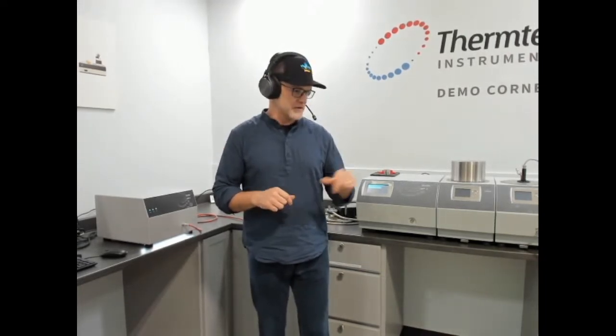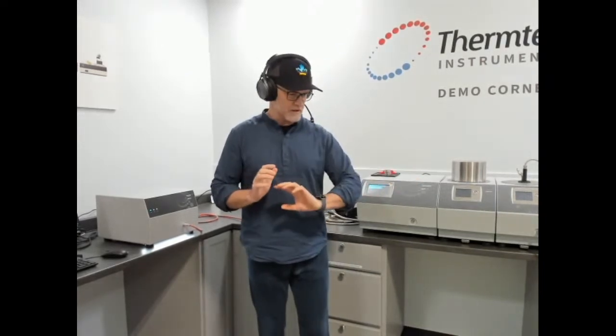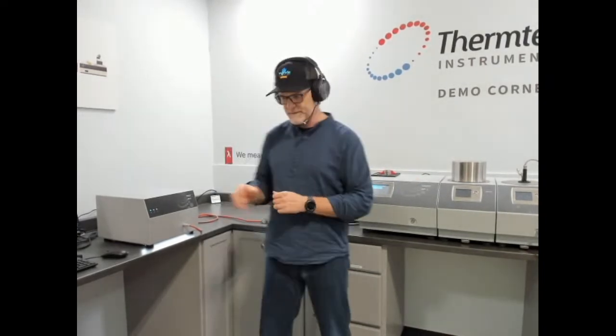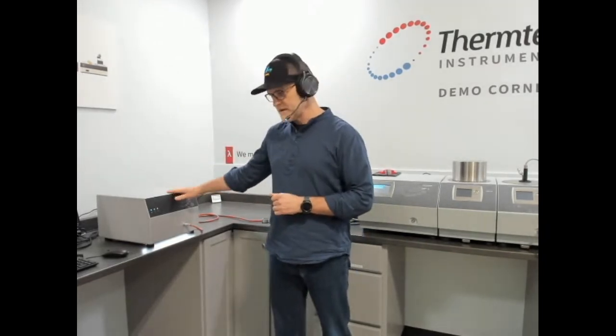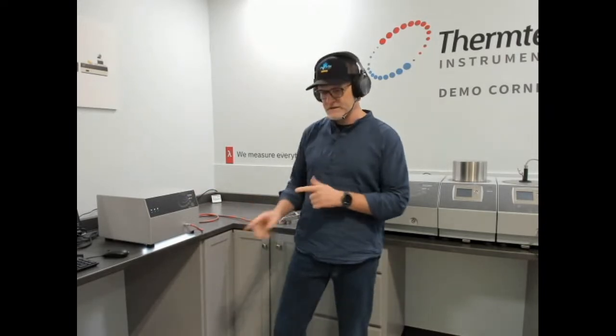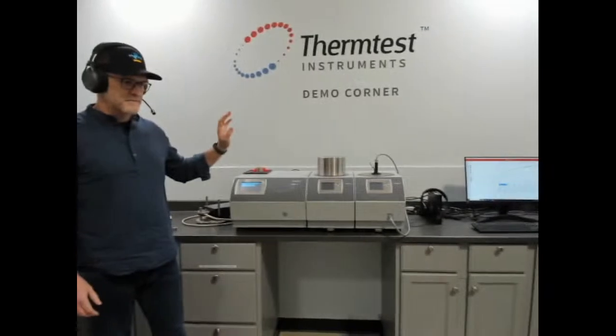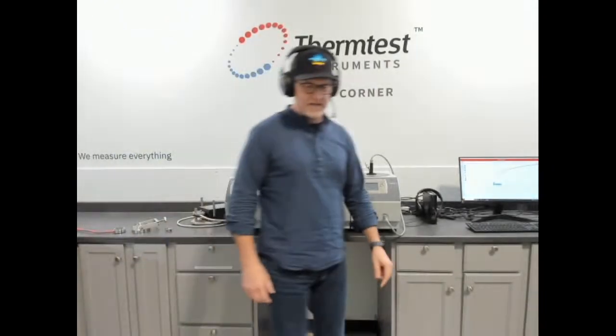equipment that's available in our demonstration corner and a little bit about them, and then we'll come back and talk about the MPV as well as some of the testing capabilities and the MTPS sensor, and get into a couple interesting topics. So we'll start with steady state.